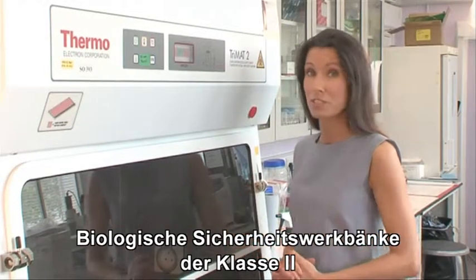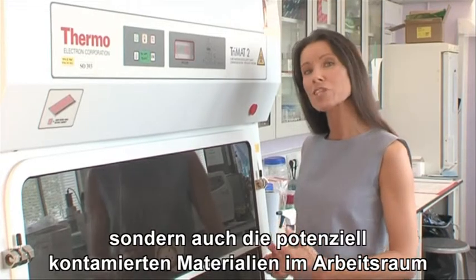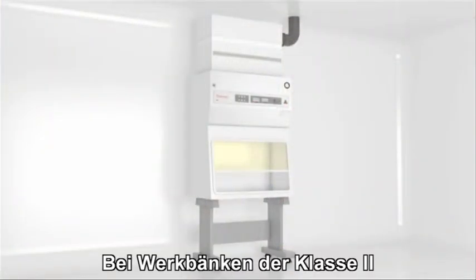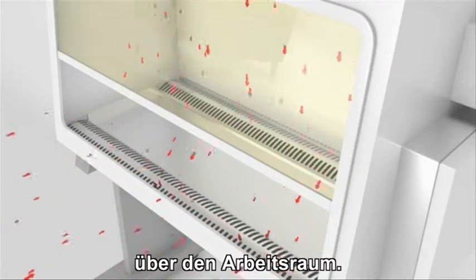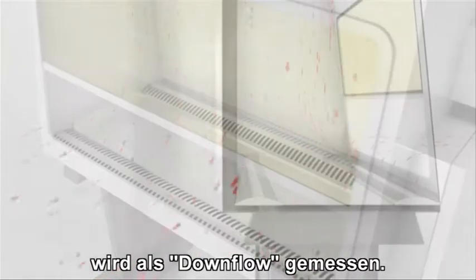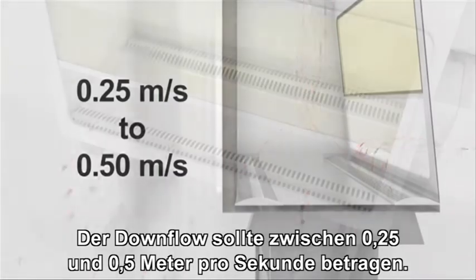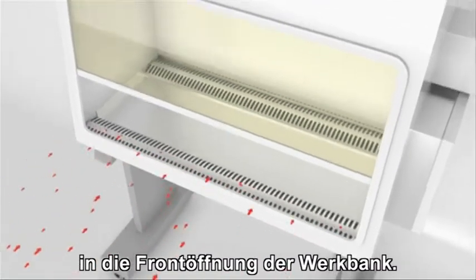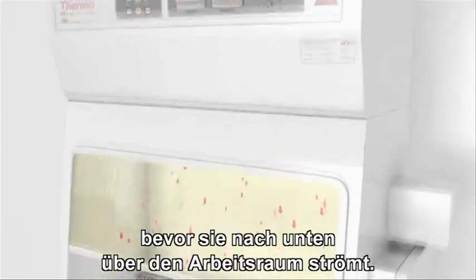The Class 2 biological safety cabinet is designed not only to provide protection for personnel, but also to protect work surface materials from contaminated room air. Class 2 cabinets differ from Class 1 by allowing only air from a HEPA-filtered sterile supply to flow over the work surface. Airflow in a Class 2 microbiological safety cabinet is measured as downflow. This downflow rate should be between 0.25 meters per second and 0.5 meters per second. An internal fan draws room air into the cabinet through the front opening and into the front intake grill. The air then passes through a HEPA filter before flowing downwards over the work surface.